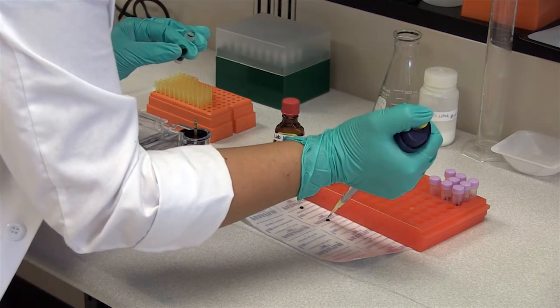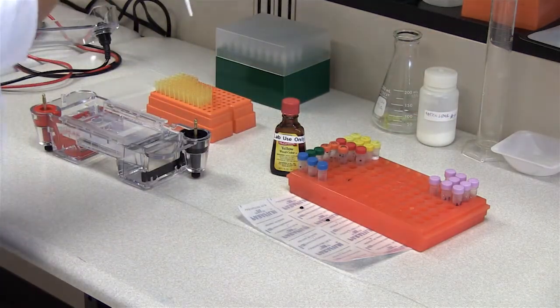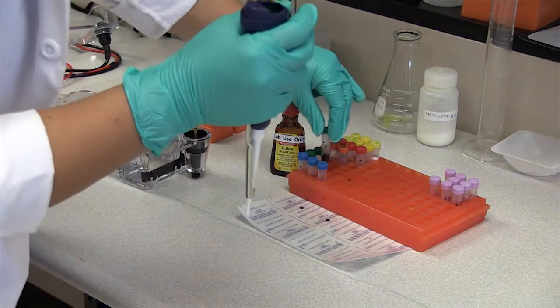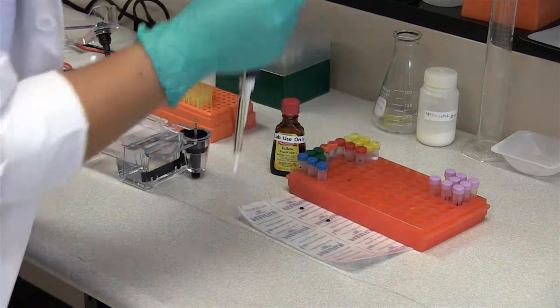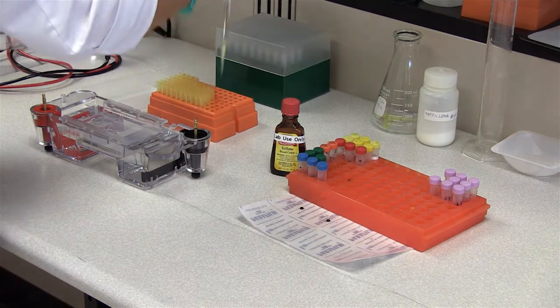You don't want to cross contaminate. And while we're just working with food coloring this time, it's a good habit to get into, especially when you start working with more important and more expensive samples.